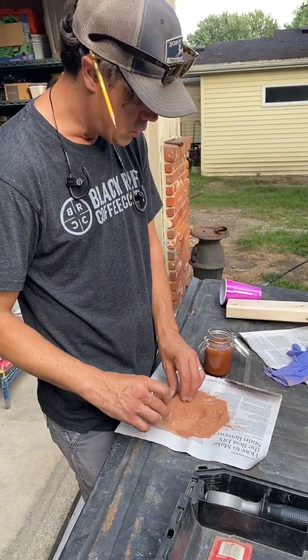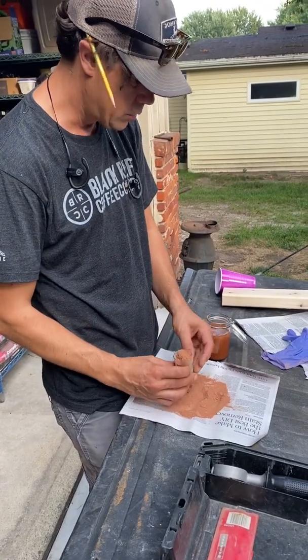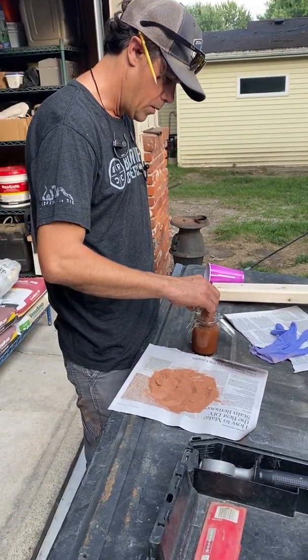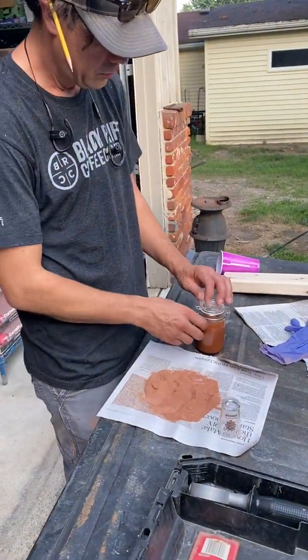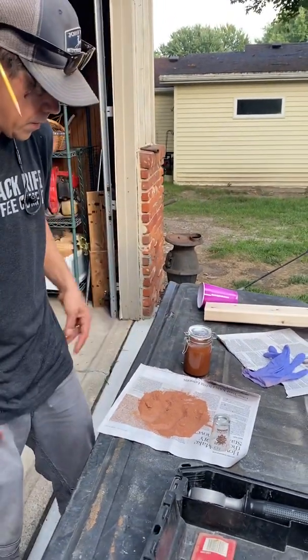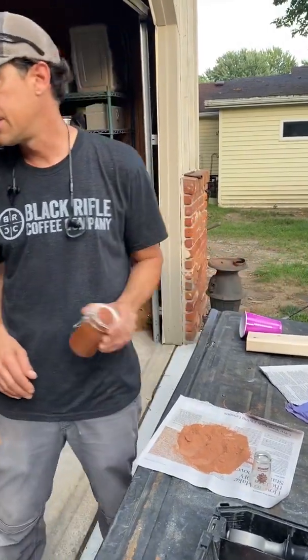But I don't want to use all of it because I want to keep some for other samples. So we'll do 2 scoops here. All right. Take 2 tomorrow. So we just want to shake it and set it somewhere.